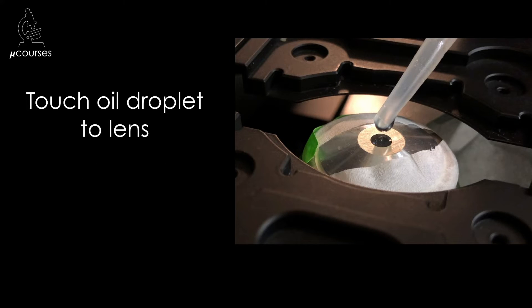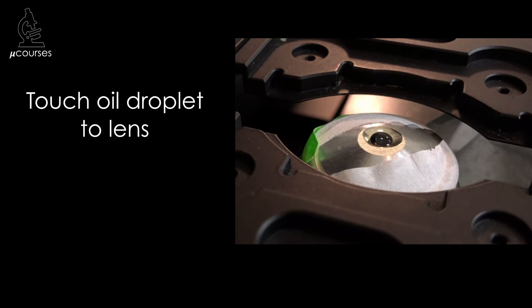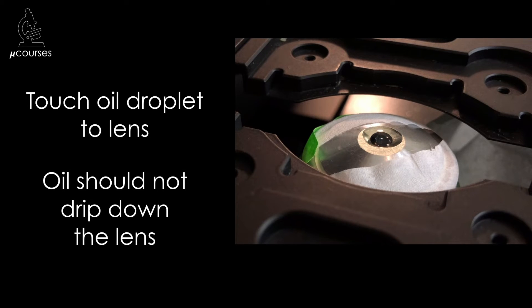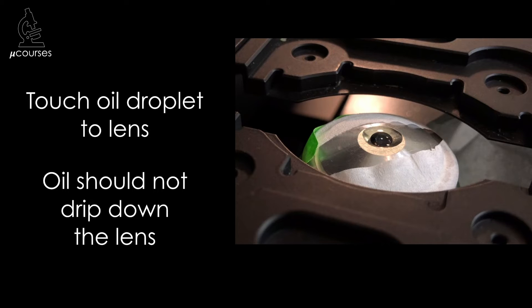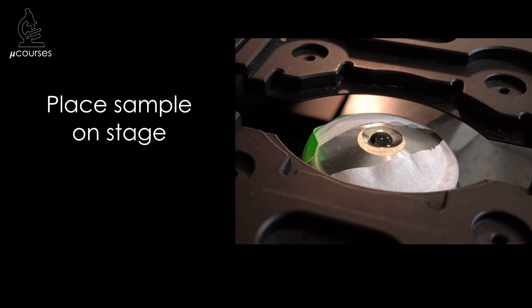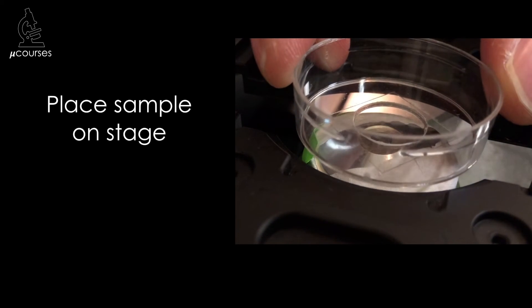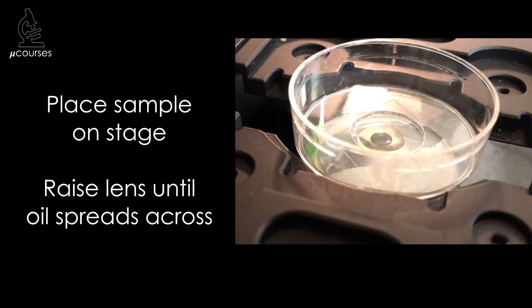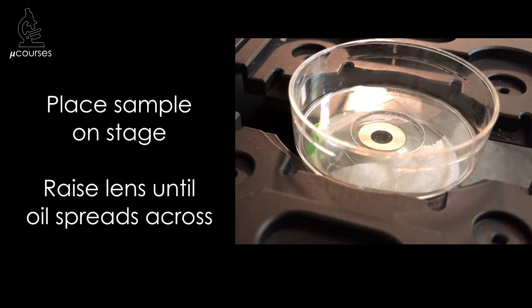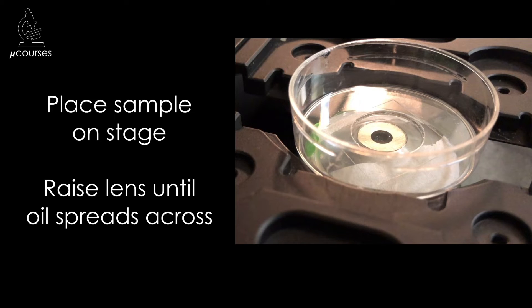Now you want to touch that oil droplet to the lens. Don't touch the dropper to the lens — that could damage the lens. You just want to touch the oil droplet. At this point, make sure that the oil isn't dripping down the sides; it should stay on the flat surface of the lens. Next, you're going to place your sample onto the stage, and as you do that, look at the objective lens so that when you bring the lens up to the dish, you'll see the oil spread across the lens. Again, make sure that the oil is not dripping down the sides.